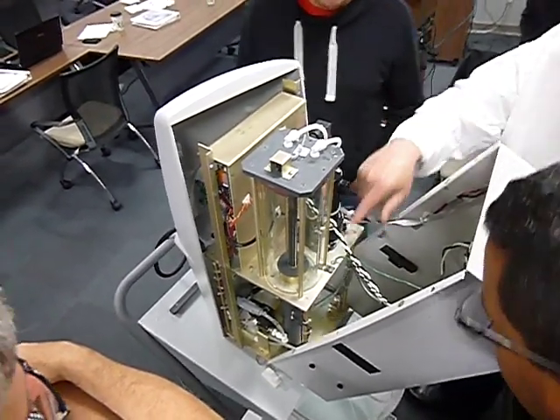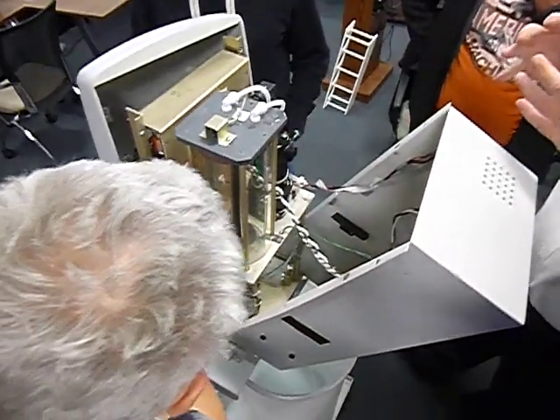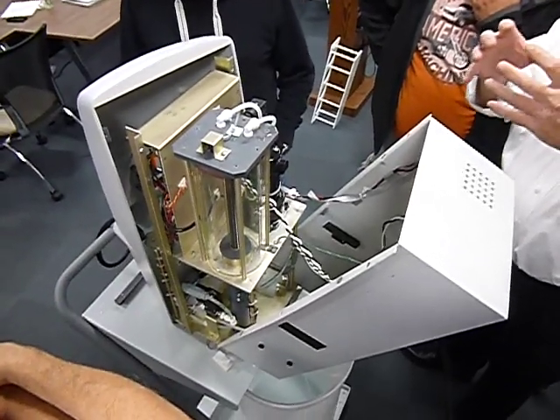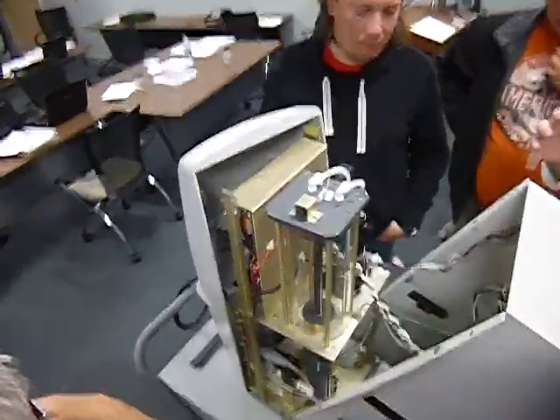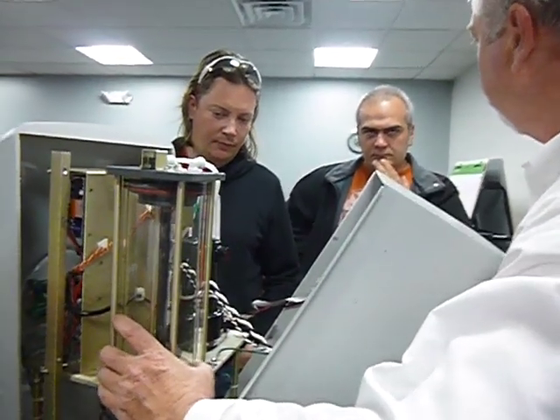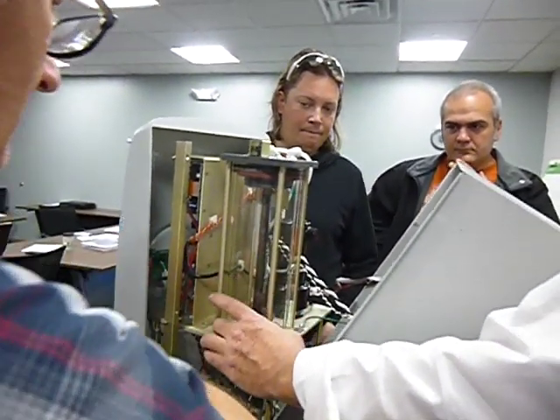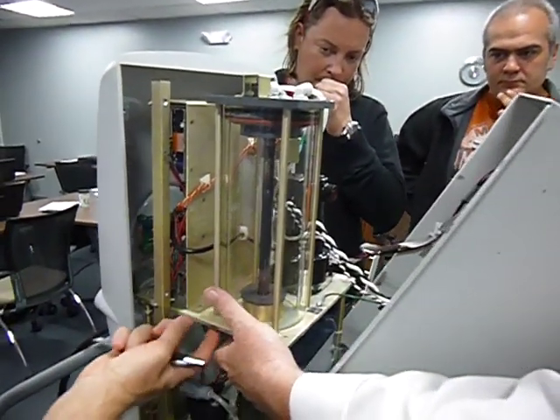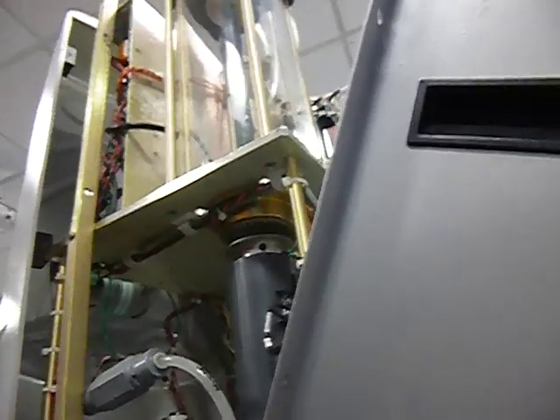So on the bottom here, you got a gasket. In reality, the glass has a floating bottom. What does that mean, a floating bottom? It's free to move. It's designed to just move a little bit here because of the gasket, because you got this coming down. So this is going to move. You got these holes in the bottom for air to escape. Actually, it's four holes. And that's just for air to go out when it's pulling in.